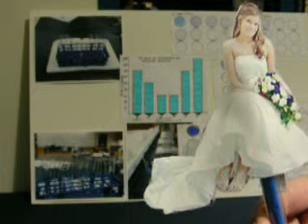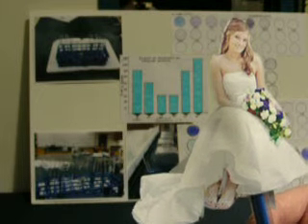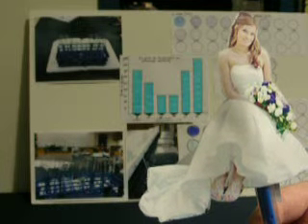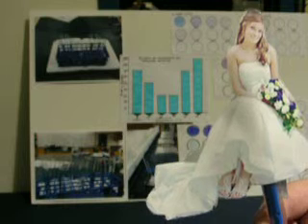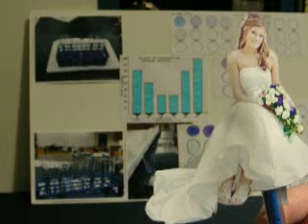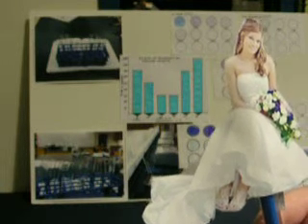After this time had elapsed, we had 100 microliters of iodine ready in each well of a watch plate. The amylase was combined with starch, and we used a micropipetter to draw up 500 microliters of the solution and place it in the watch plate. We continued to do this in 30-second increments. The results were recorded until color change no longer occurred in the wells. The experiment was then repeated for each separate temperature.